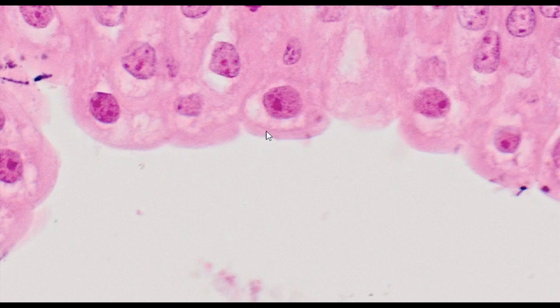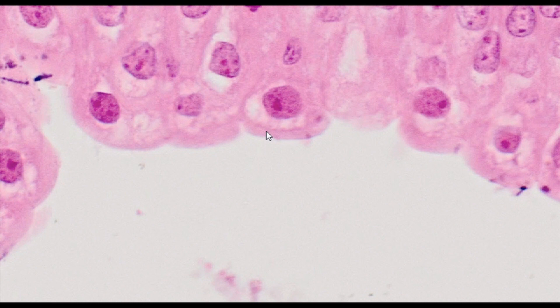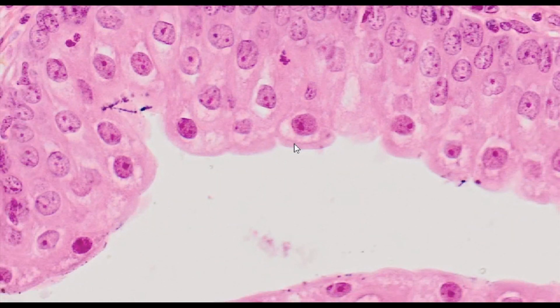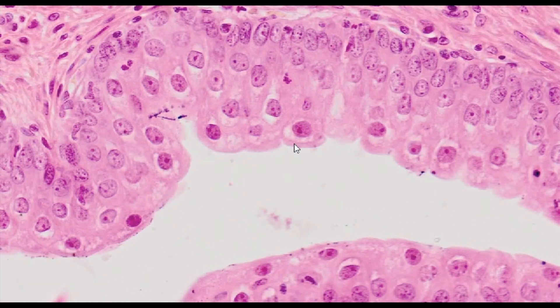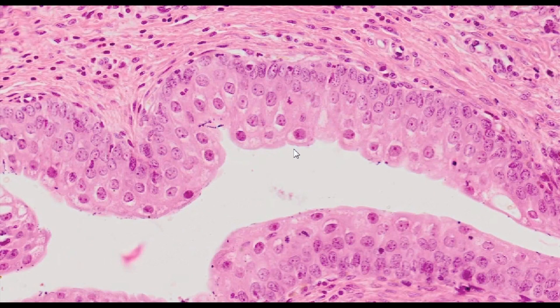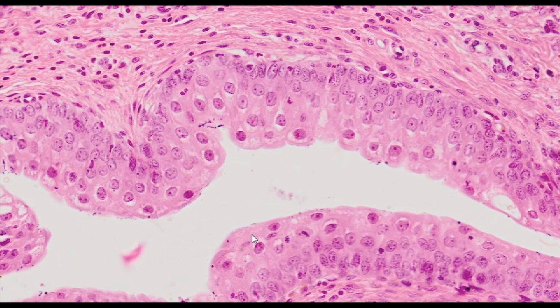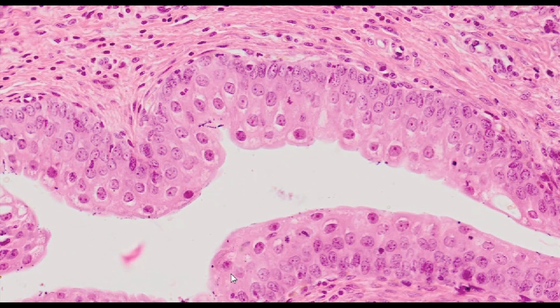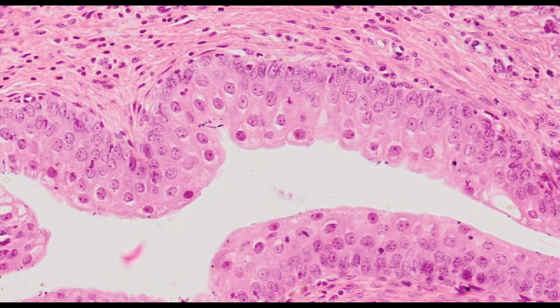Individual subtypes of uroplakins can be detected using specific antibodies in immunohistochemistry. This methodology is used for the detection of urinary tract tumors, where increased expression of these proteins is now a recognized diagnostic marker.